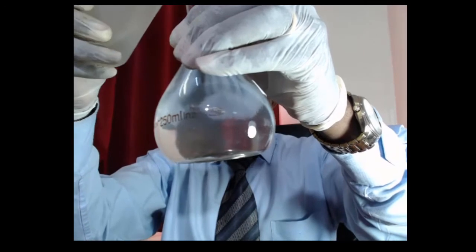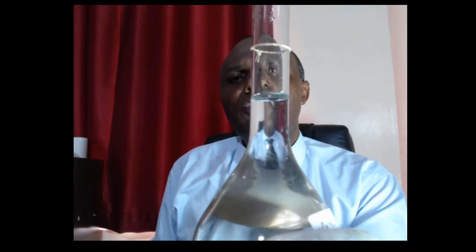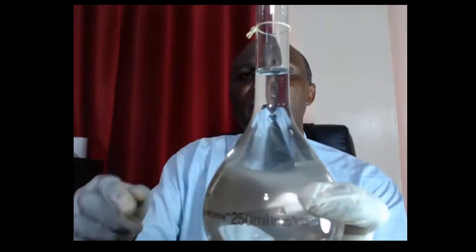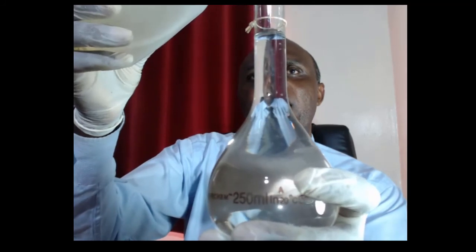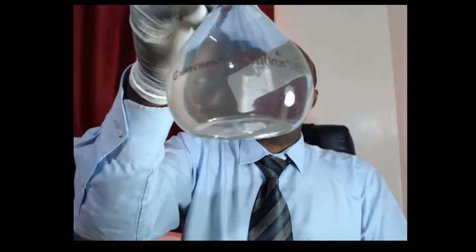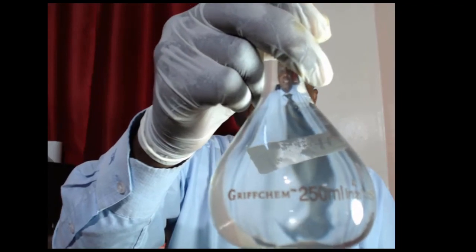Remember that the 250 milliliter mark is indicated there on your volumetric flask, and all volumetric flasks have that mark, and we are supposed to fill our volumetric flask up to that point, so that now 7.875 grams of our acid can make a solution of oxalic acid. So that is the oxalic acid we have prepared, and this acid is exactly 0.25 M. And what is inside here is 7.875 grams of oxalic acid. That is in terms of mass. So that is how we prepare molar solutions.